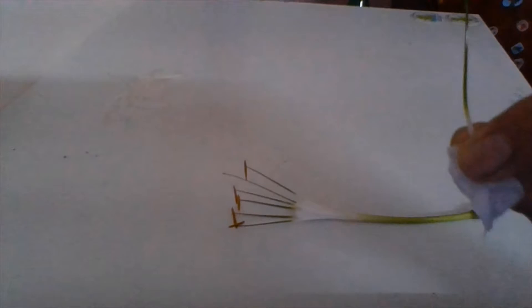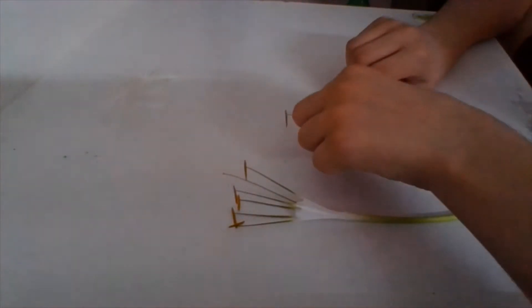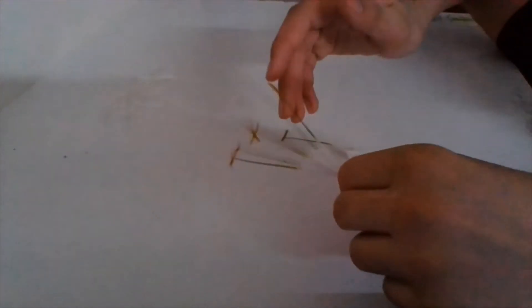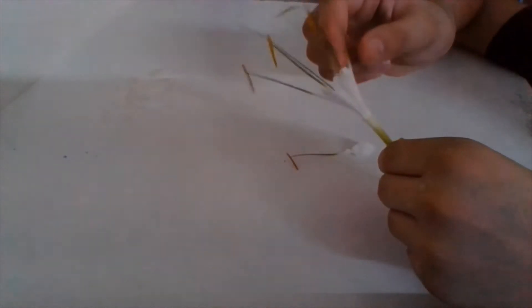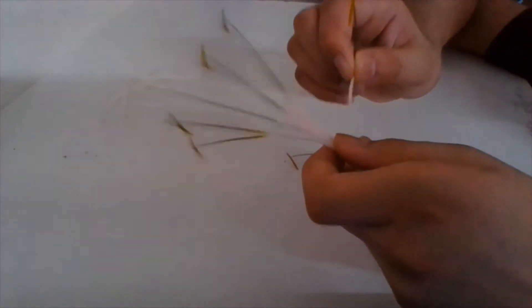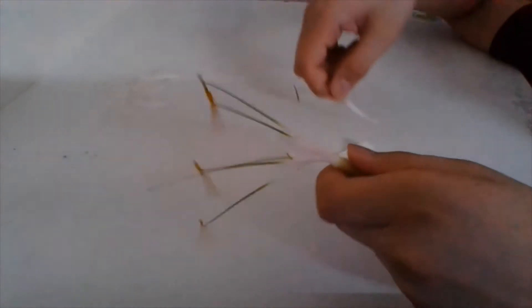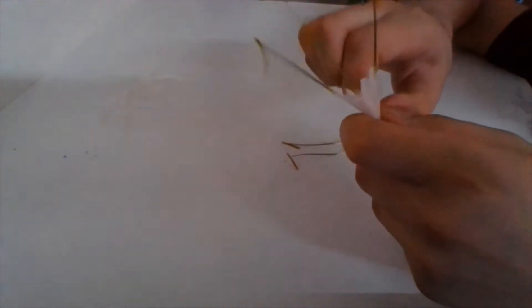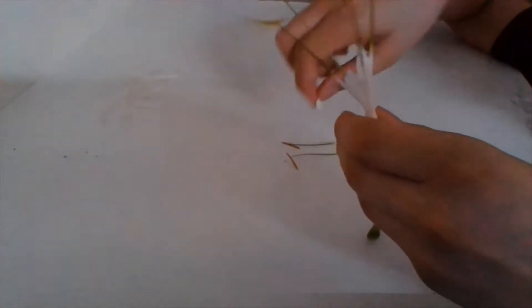There are many stamens possible in a flower — as you can see here there are six stamens. All six stamens together are called the androecium.